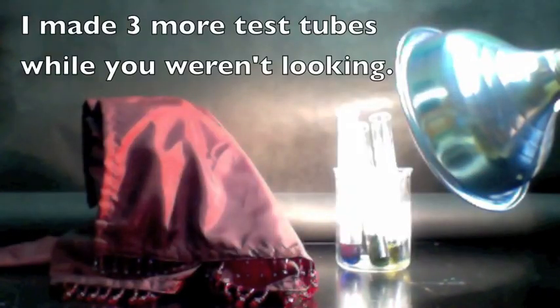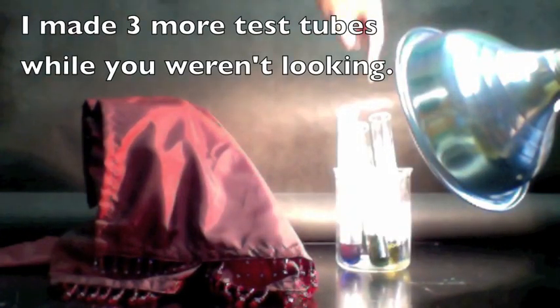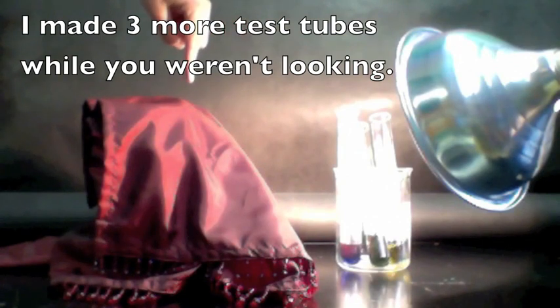We are back. A little bit of time has passed. And we're going to see what has happened to our samples in the light versus the ones that we put in the dark. So let's take a look at the ones that are in the light first.